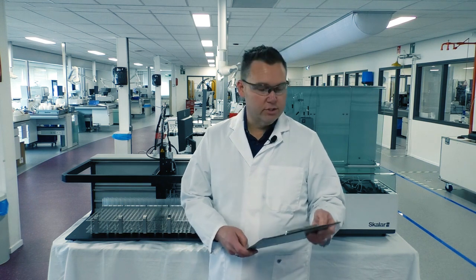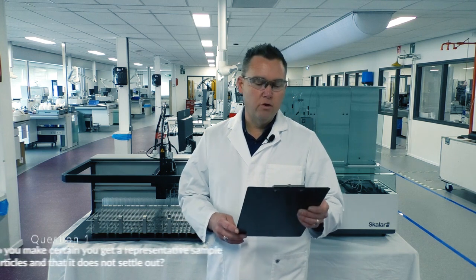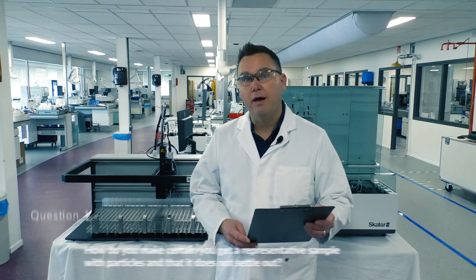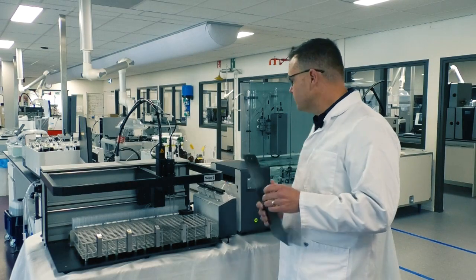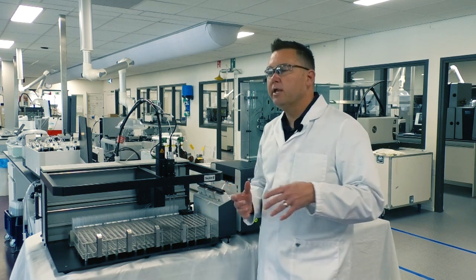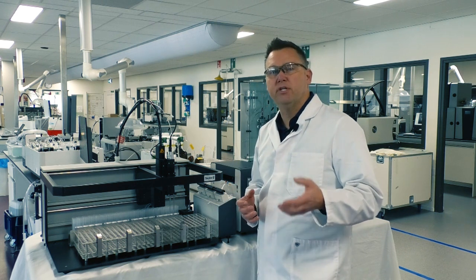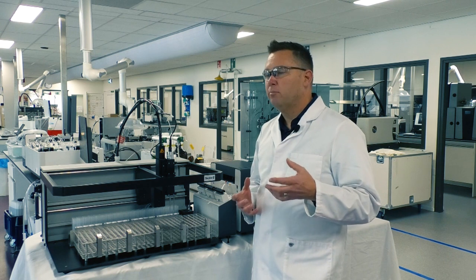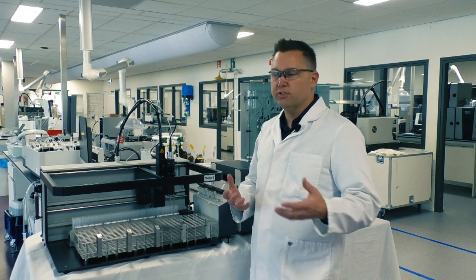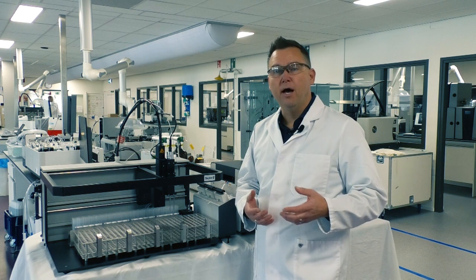So getting right to our questions, our first question we get the most asked is, for inline digestions, how do you make certain you get a representative sample with particles and that it does not settle out over time? So, as I was saying, if we look at our auto sampler here, what we see is when we're running, especially for total nitrogen and total phosphorus, we have to make sure that we actually pick up a representative sample of that sample, and a lot of times they do have particles. And if we don't pick those particles up, then tests like total nitrogen and total phosphorus, our results do not compare to those of our offline manual digestions.